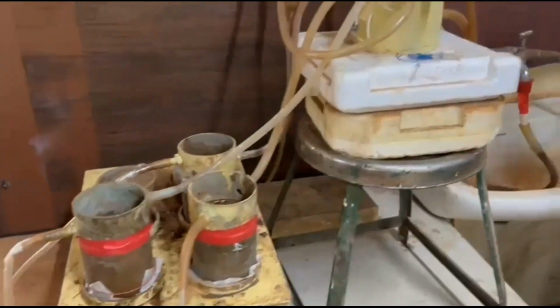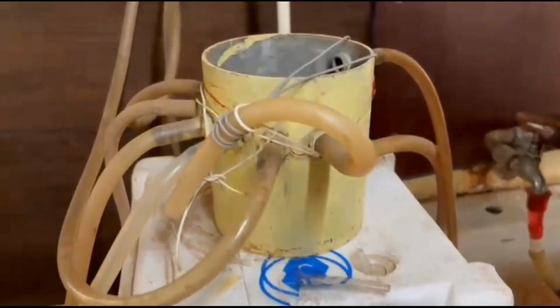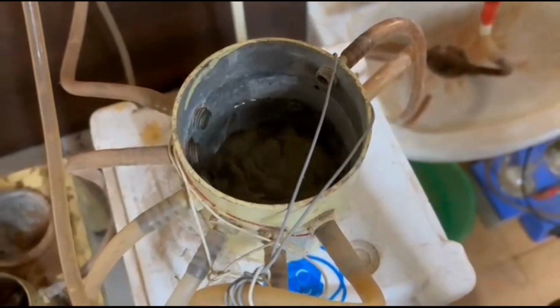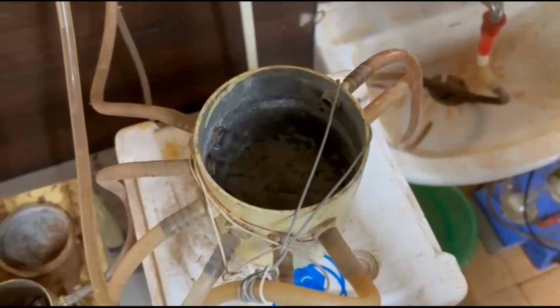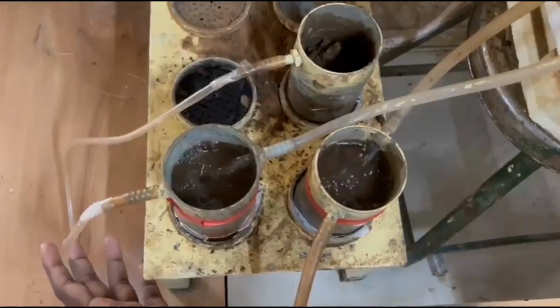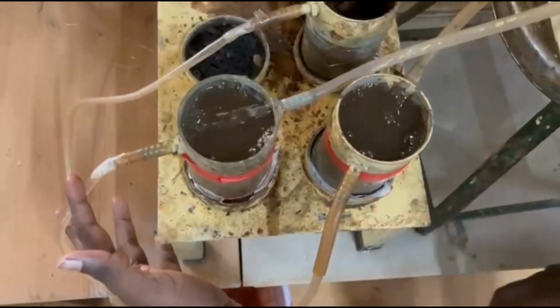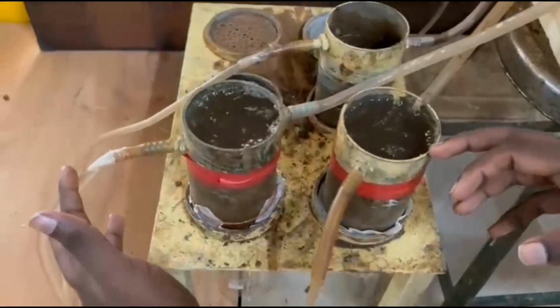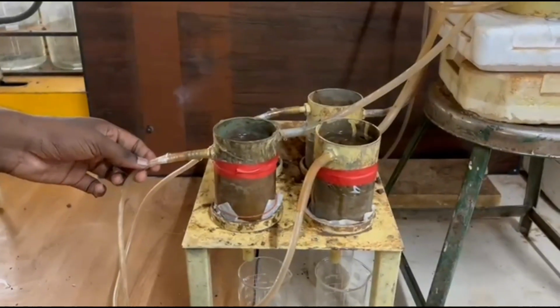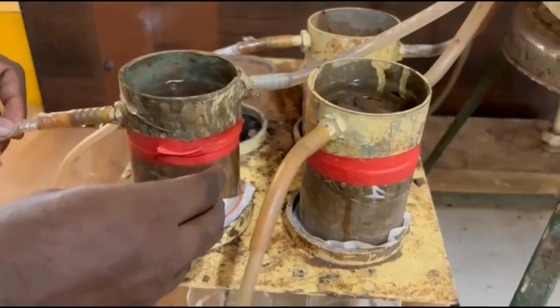Now let's open the tap. Water then flows from the tap to the overhead water system. As the overhead water system is filled, water is then supplied to the overhead water supply system through the inflow valve. After saturation of the soil sample, the soil then conducts the water. The water then percolates down through the soil sample and through the funnel and gets collected in the beaker.